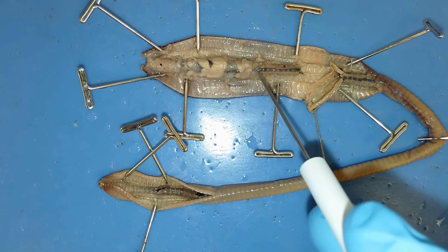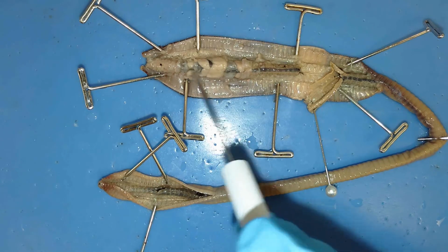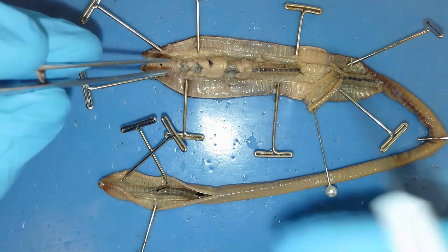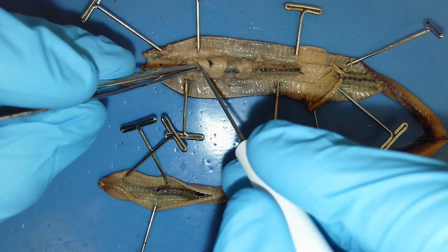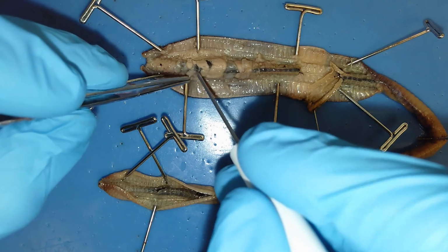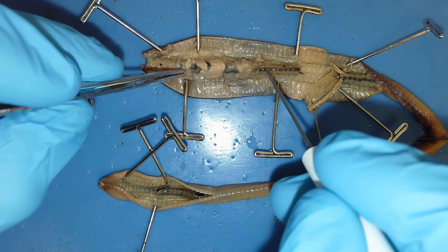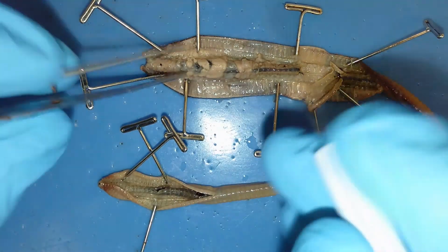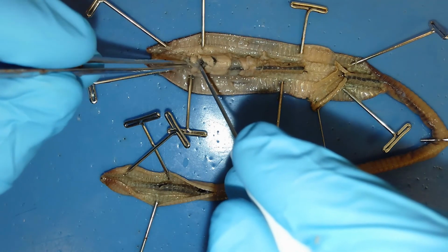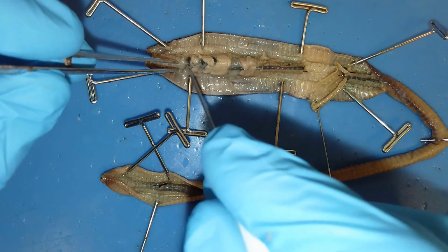So the next system that I'll talk about is the circulatory system, and let me see if I can get some of this membranous material off of the pumping structures. One of the most prominent structures that you can see so far runs along the top of the intestinal tract. This structure right here that runs down the length of the body is called the dorsal blood vessel. So that's carrying blood down the length of the body, carrying nutrients, carrying waste, and all necessary things for this organism to survive.